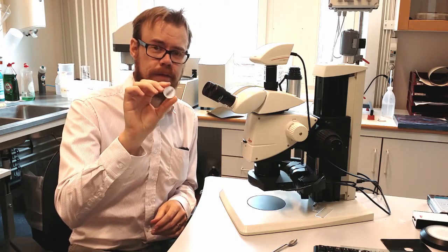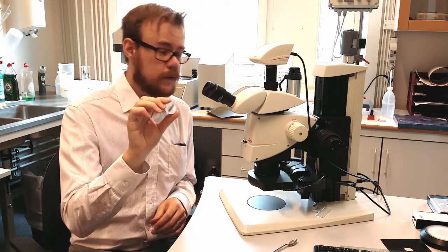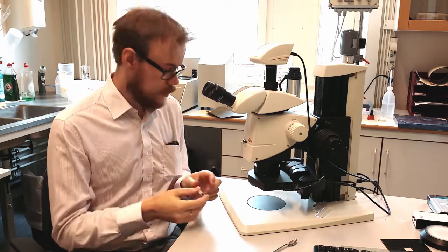Okay, here I am with this piece that we grinded down now. Let's look in this microscope to see how it looks like.